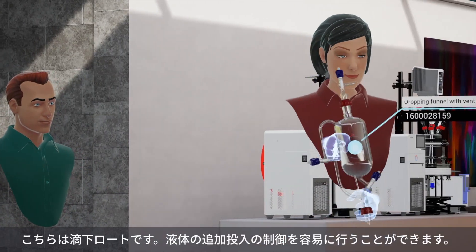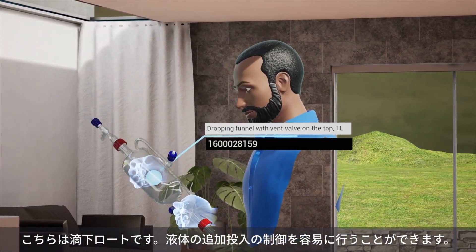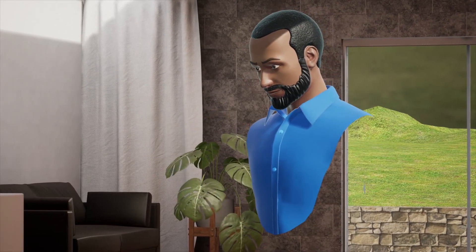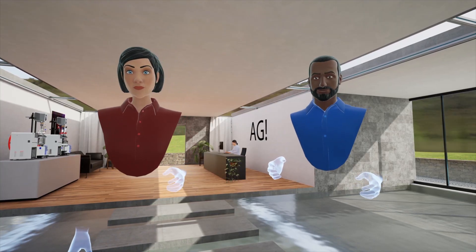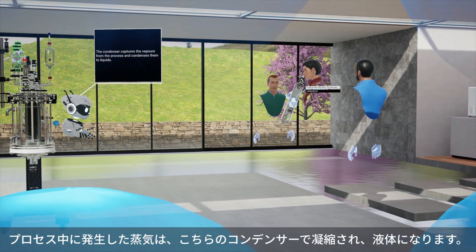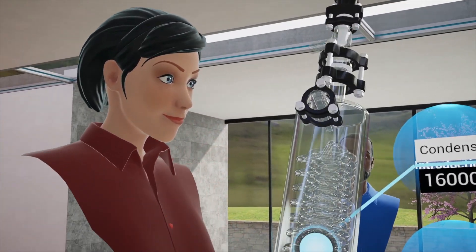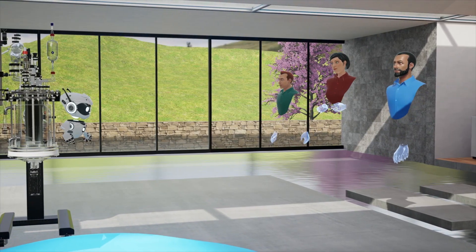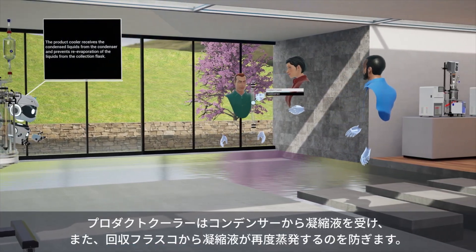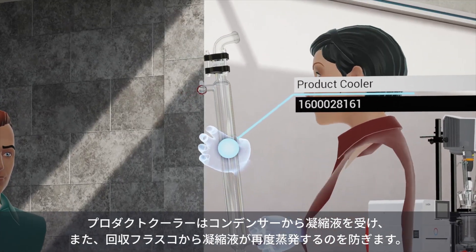Here is the dropping funnel. Controlled addition of liquid substances to the process is made easy with the dropping funnel. The condenser captures the vapors from the process and condenses them to liquids. The product cooler receives the condensed liquids from the condenser and prevents re-evaporation of the liquids from the collection flask.